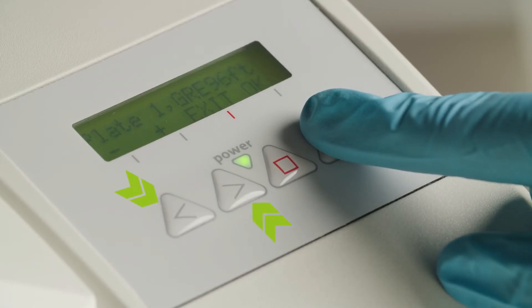Use the arrow keys to choose a plate definition identical to the well format of your plate, then press OK to change the plate parameters.